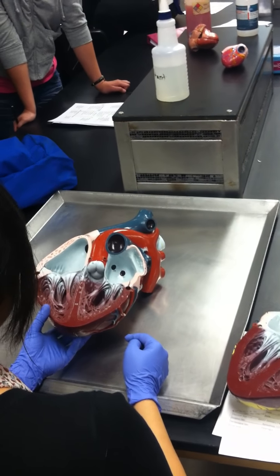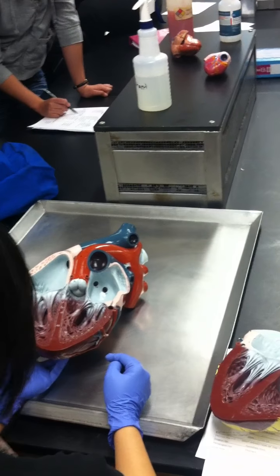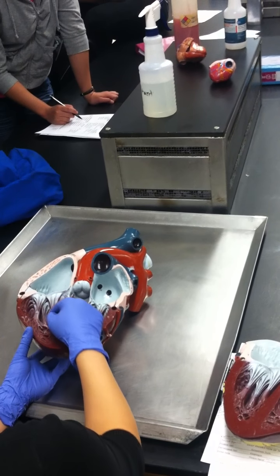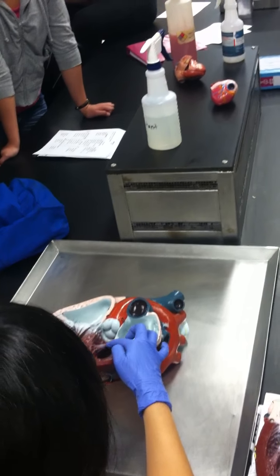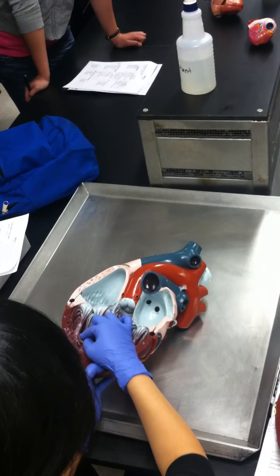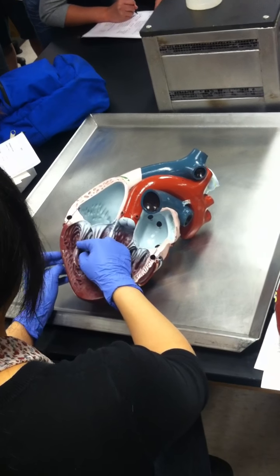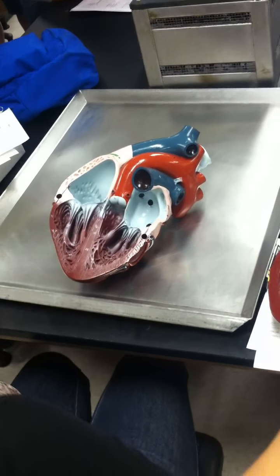Okay. The next term on your list, you guys see where it says papillary muscles? Papillary literally means nipples, and these nipple-like structures, you guys see that? It looks like a nipple, right? These structures help you hold on to the chordae tendineae to the walls. So they are those structures actually connecting the chordae tendineae to the walls.